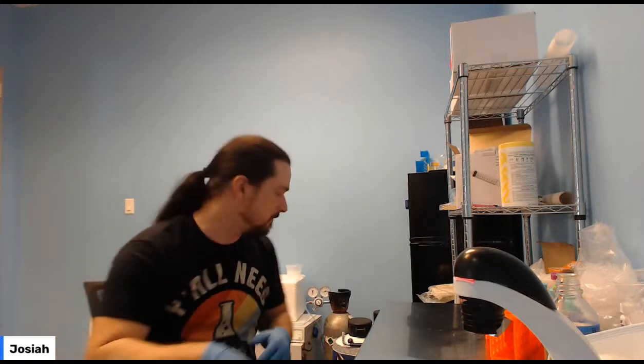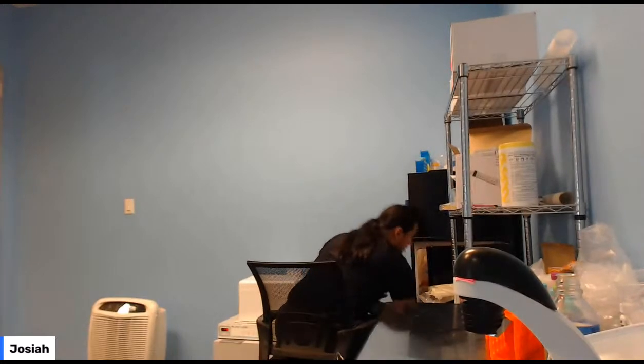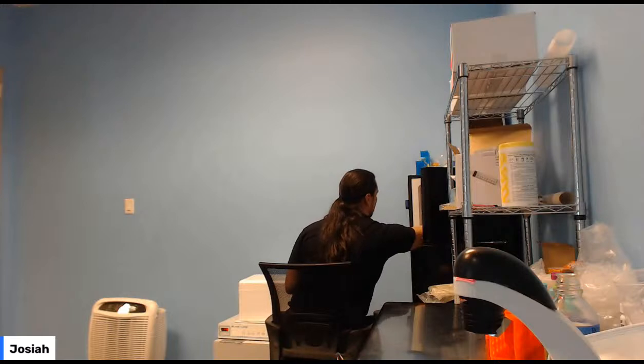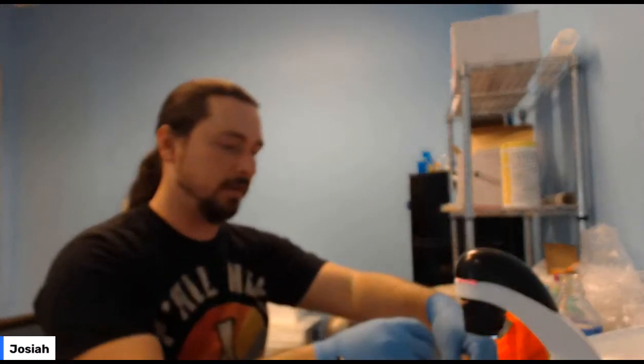It's just an incubator. But okay, so what I'll do is we'll get out some things to warm up. I'm going to do that, but you guys won't actually need to do that.